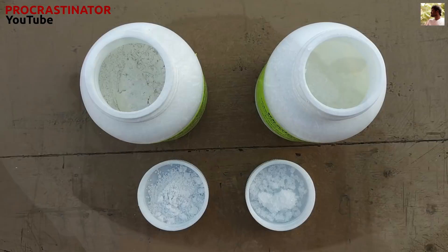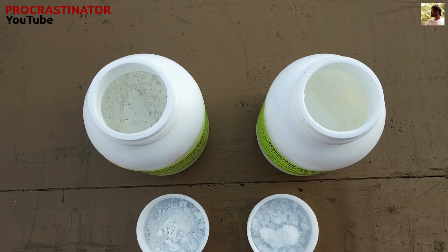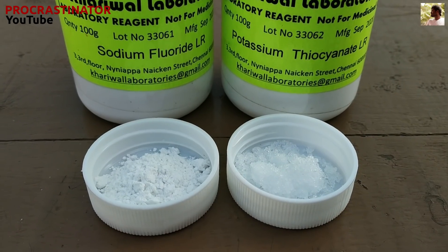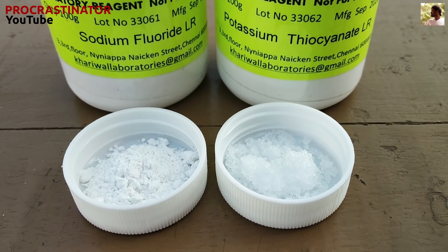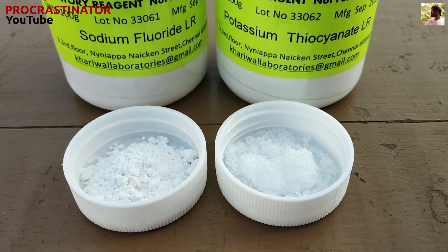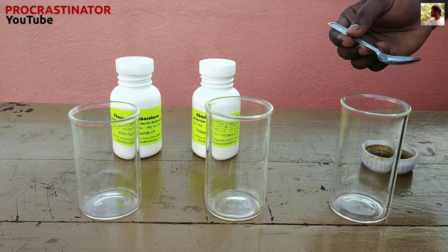Let's look at the other two chemicals. The sodium fluoride is a solid powder. The potassium thiocyanate is also a solid powder.